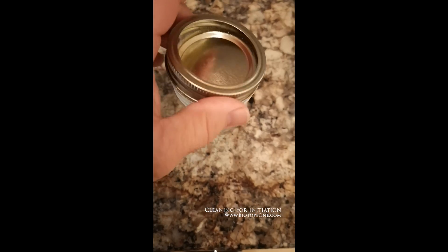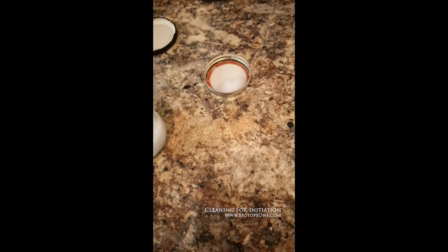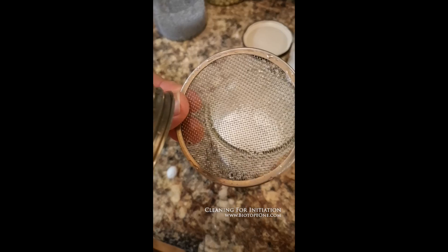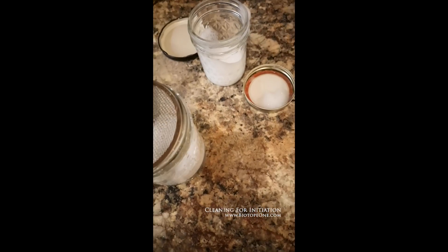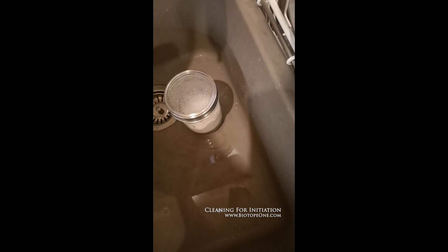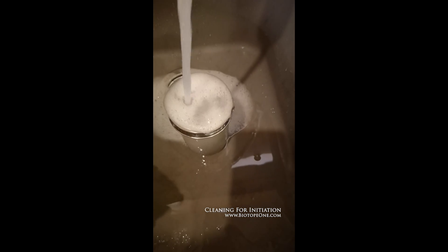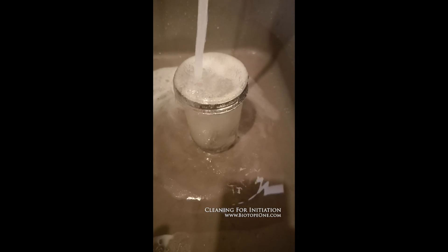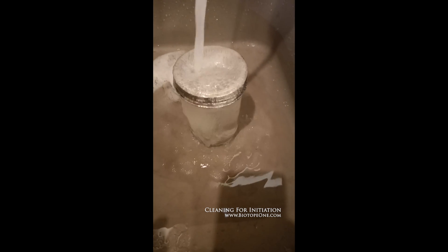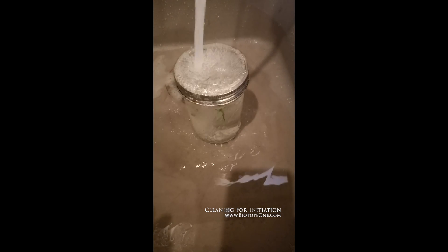There are workarounds to some of these things. I'm doing this by hand with a mason jar, but with the help of a sprout kit made for mason jars to somewhat automate this. Make sure it's not too hot, not too cold — I like it a little bit warm. You can leave it in here for a while; you can see it just tumbles it. I'm also going to add a little bit of Johnson's whenever I go to put it in the bleach, because it helps the bleach penetrate down past the surface of the plant material.